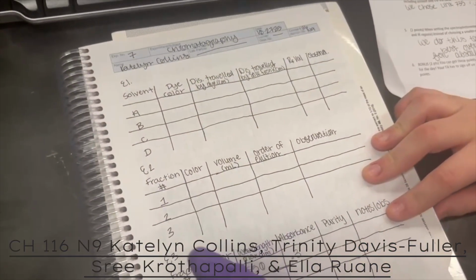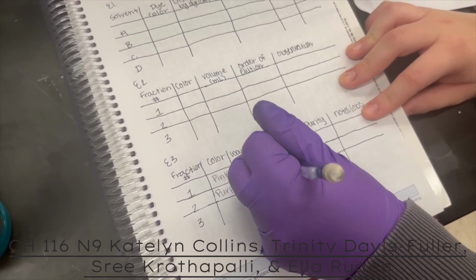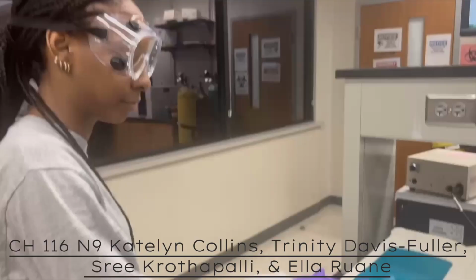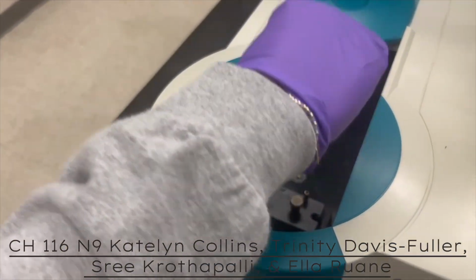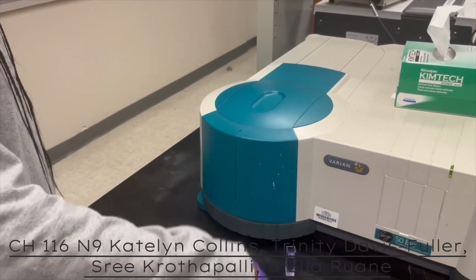Failure to properly clean the cuvettes and zero the machine will lead to the machine including the solvent's absorbance, fingerprints, or any other disturbance in the measurement. And if this happens, your readings will turn out higher than they should be, leading to incorrectly high concentration calculations.